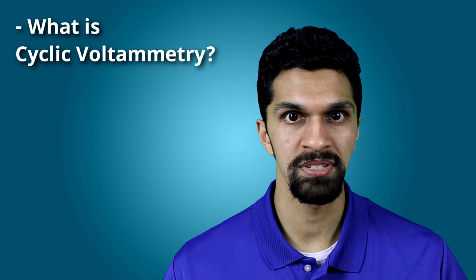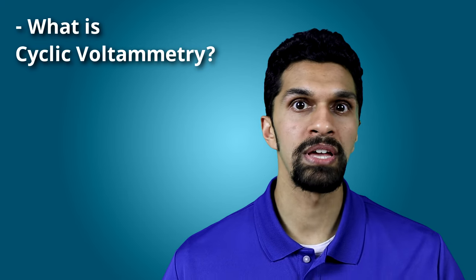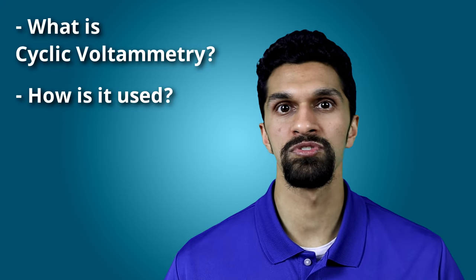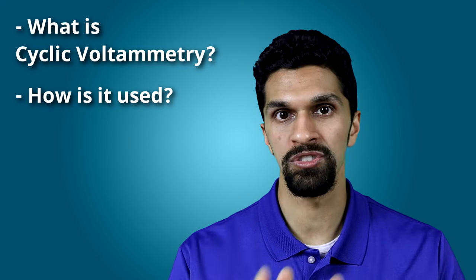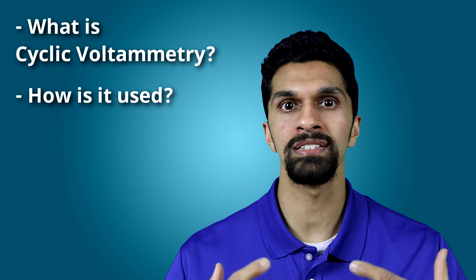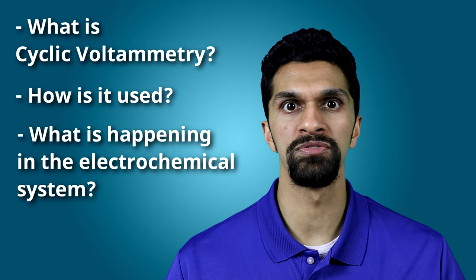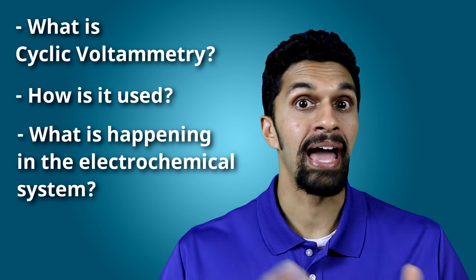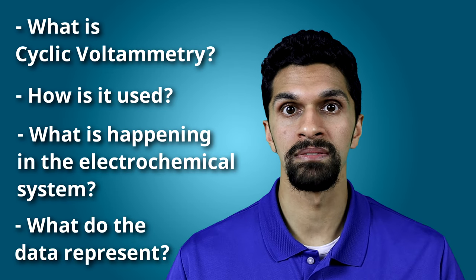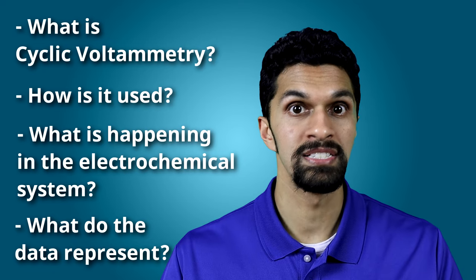This video is broken up into several sections. First, we're going to discuss what is cyclic voltammetry, what is the technique and the parameters around the technique. We will then discuss how cyclic voltammetry is used or applied to a three-electrode system, specifically with a focus on understanding what is physically happening in our system, what electrochemical phenomena are occurring, and how those electrochemical phenomena manifest themselves in the data — how they manifest themselves in the cyclic voltammogram.